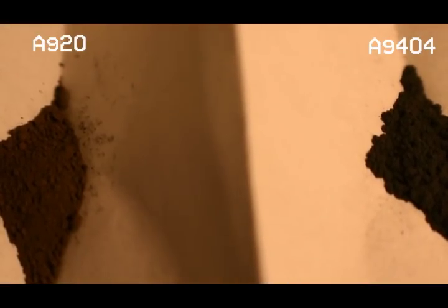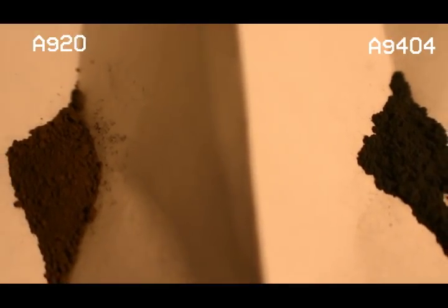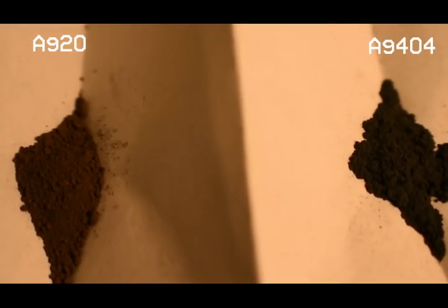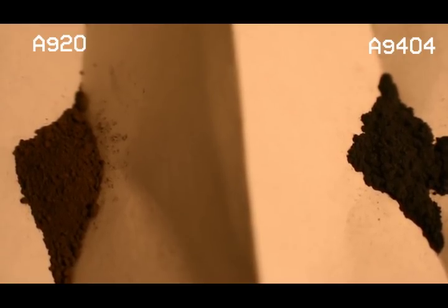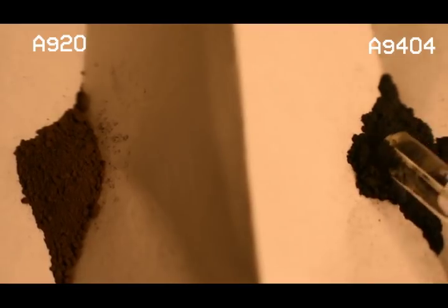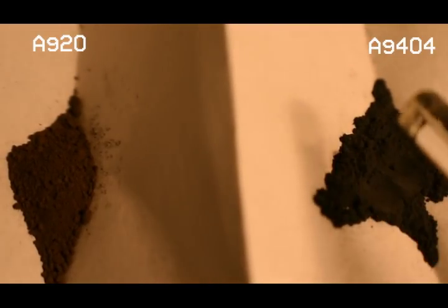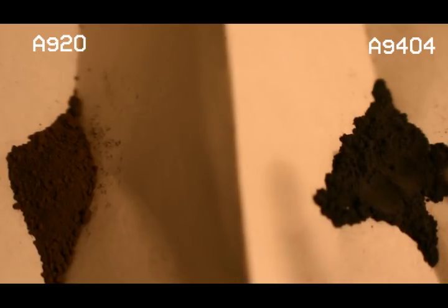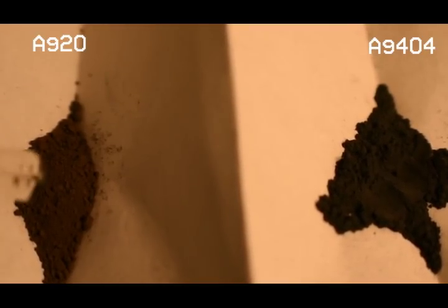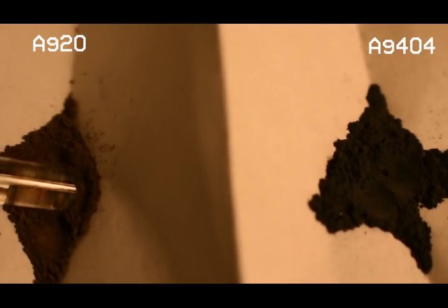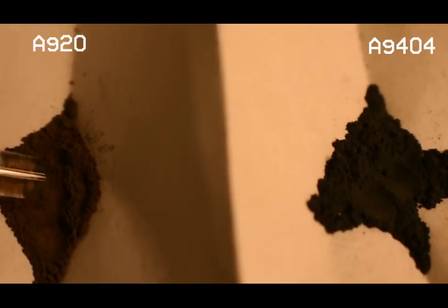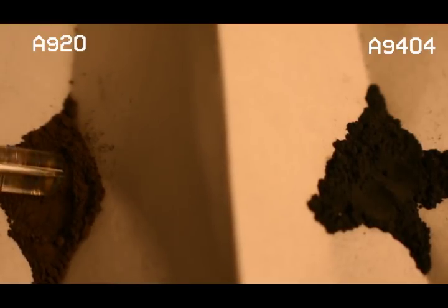What I have here are the two common oxides of silver. On the right, I have silver 1-3 oxide, which is the one we just made, also known as silver peroxide. And I just found out the formula is also Ag4O4, so Ag2O2 is just the monomer, I guess. And on the left, I have silver 1 oxide, or Ag2O, and that's brown as we can see. It looks a little darker on camera, but it's more of a brown, sort of tan in real life.